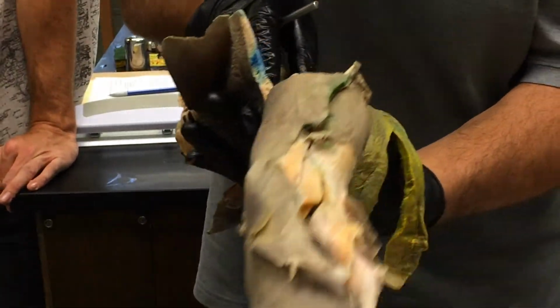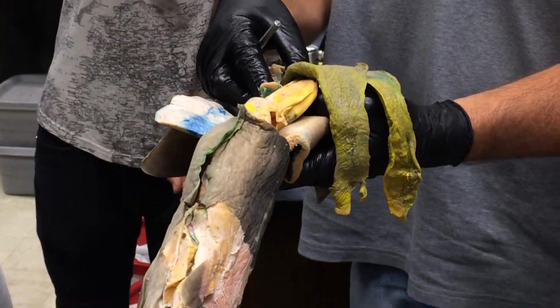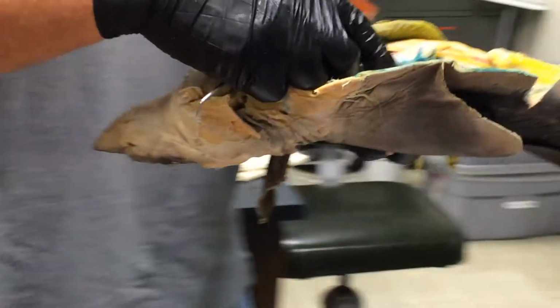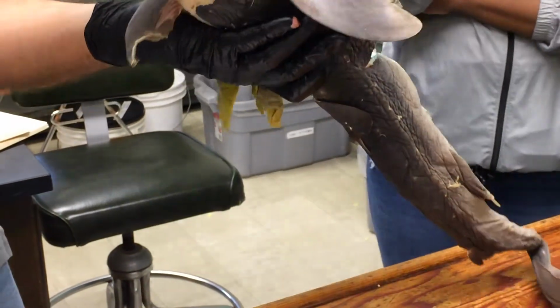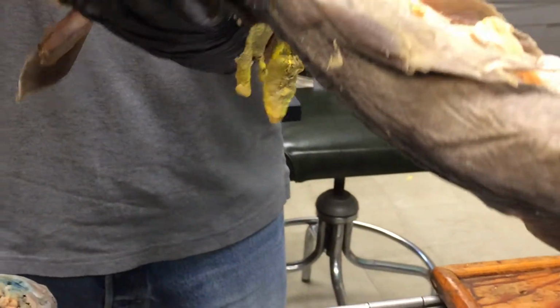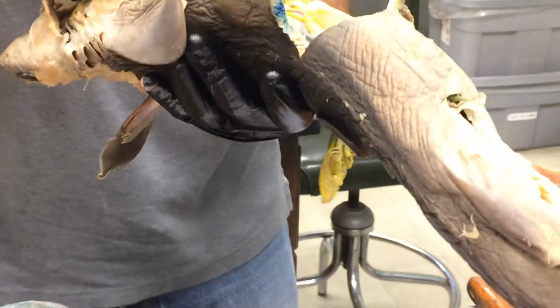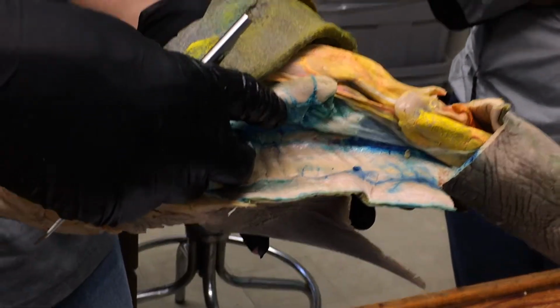Yeah, sort of. There we can see a little bit of mesentery right there, connecting the testis to the dorsal body wall, and that's called the what? You're right, mesorchium. Okay. Did you see that at all? No. Okay, so let me know if you don't see it, because I'll just wave my shark around happily.